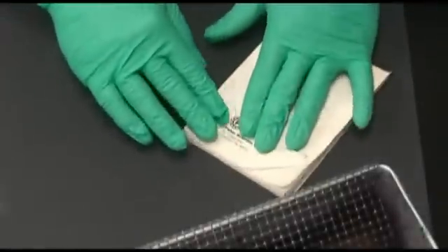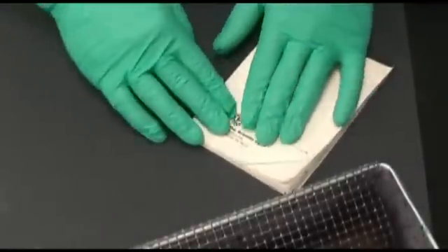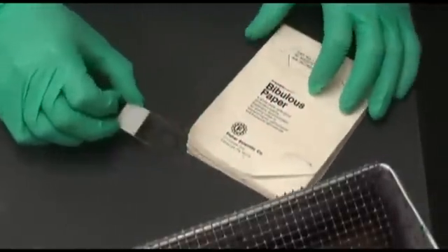However, try to avoid wet or stained sheets. Make sure not to rub the slide, as this will remove the bacteria.